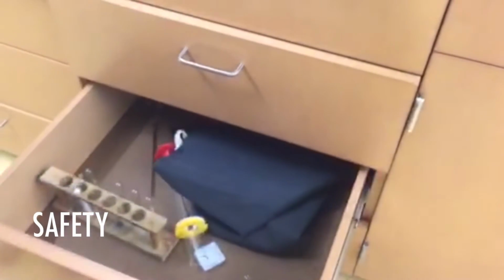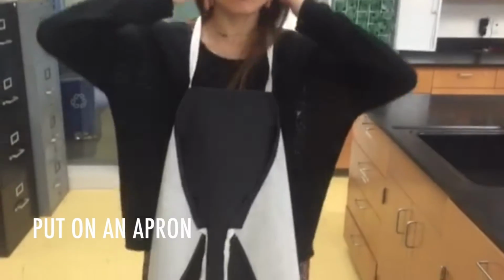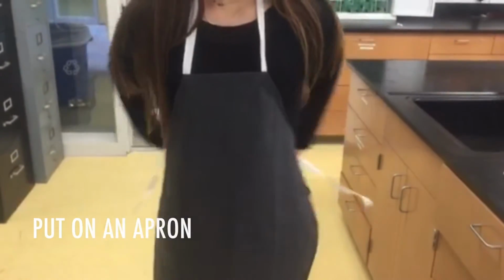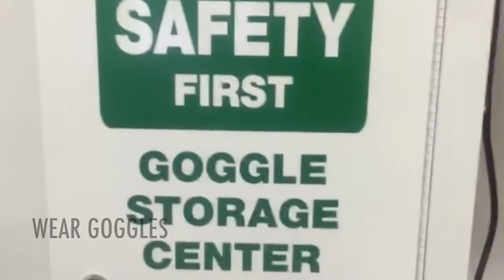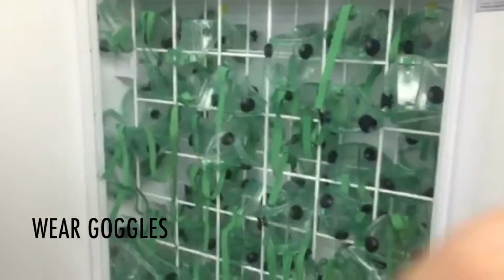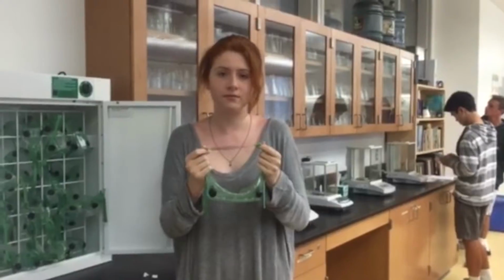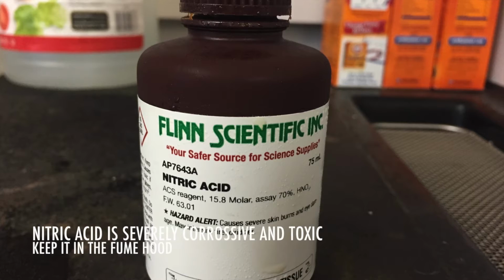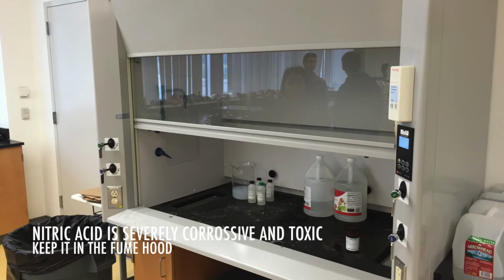For safety, wear chemical splash goggles and a chemical-resistant apron. Nitric acid is very corrosive to all body tissue and toxic by ingestion and inhalation. In the lab area, wear closed-toed shoes, not sandals. Remember to always keep nitric acid in the fume hood.